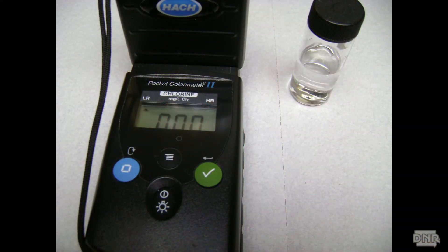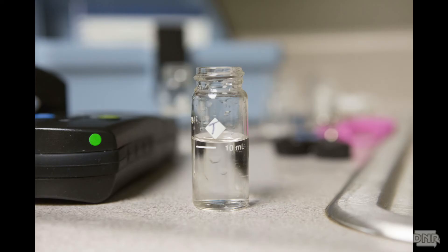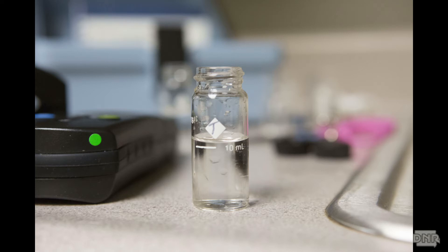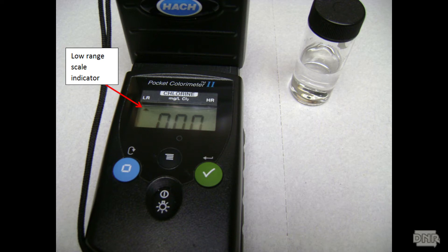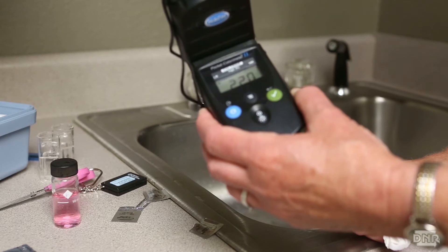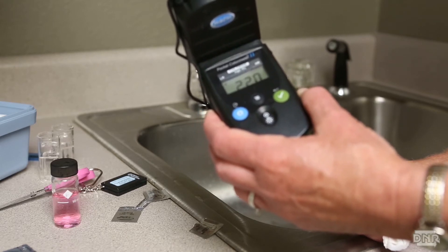I am going to show you the analysis using a Hach Pocket Colorimeter 2. Be sure to check the instructions for your specific instrument. This test kit uses 10 ml samples. Fill the sample vials to the 10 ml line. I am doing the measurement on the low range scale and the highest level that can be measured is 2.2 mg per liter. If a reading flashes at you or reads over limit, the value is greater than the upper limit of your testing equipment. You do not know the value other than that it is greater than 2.2 mg per liter.